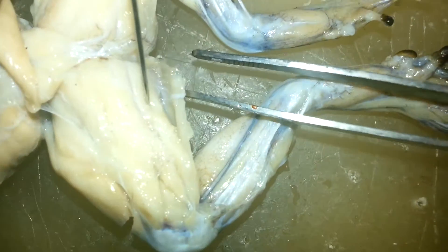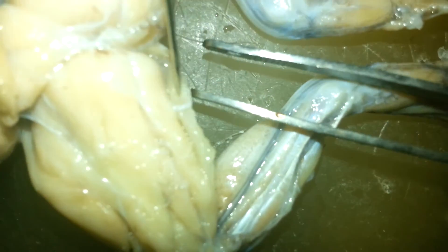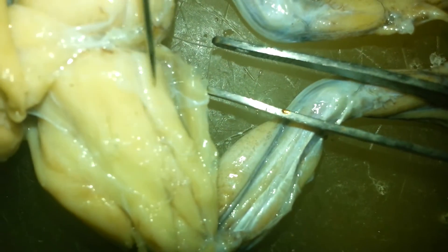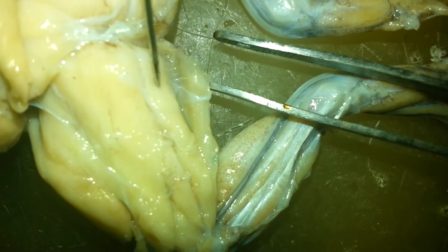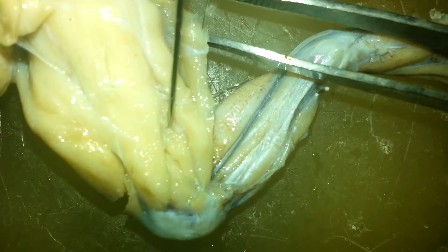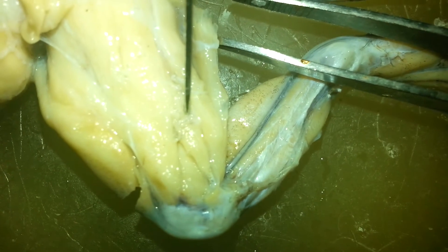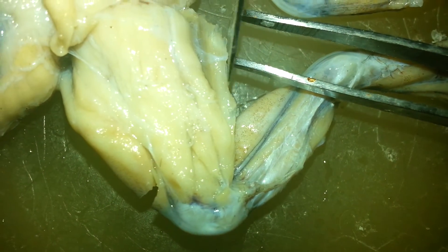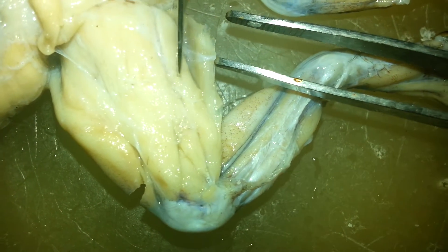This is the gracilis major, gracilis minor. Gracilis minor, gracilis major. Semitendinosus — in between the gracilis major and the adductor magnus.